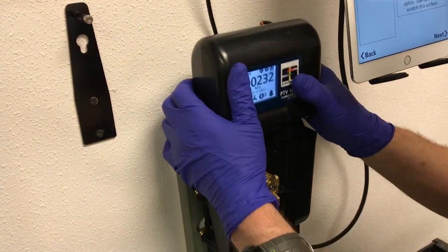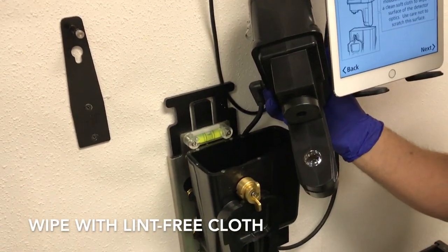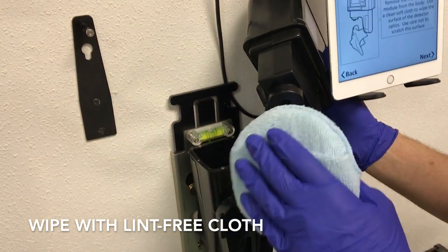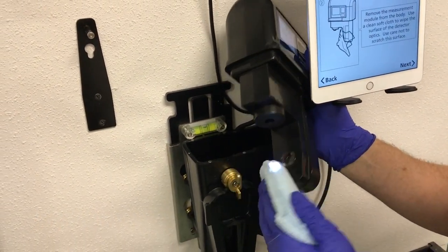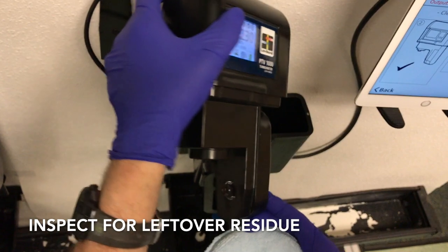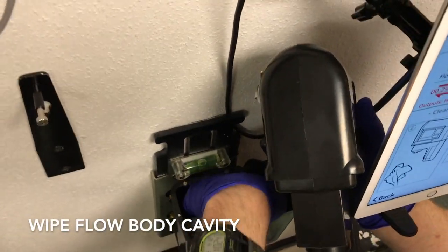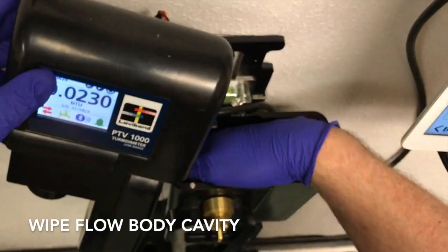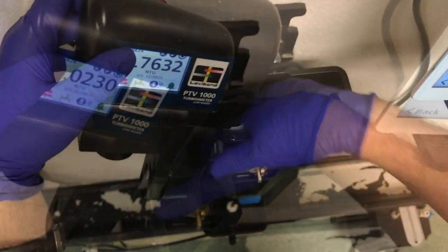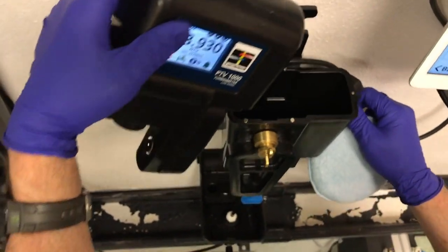Following along, we want to remove the measurement module and wipe with a lint-free cloth. Inspect for any leftover residue. Continue by wiping down the flow body cavity.